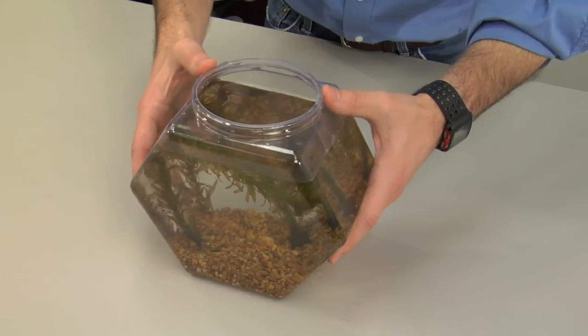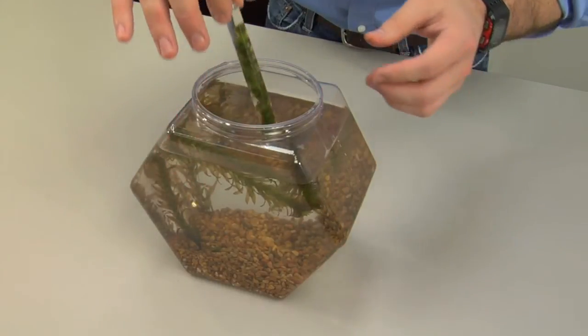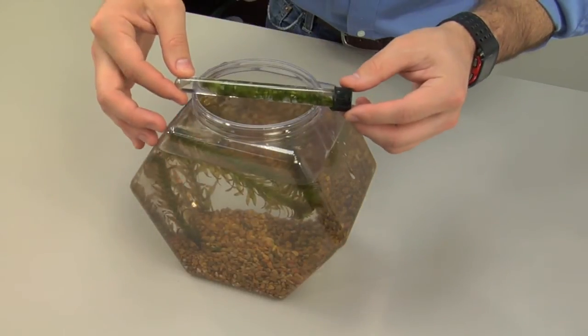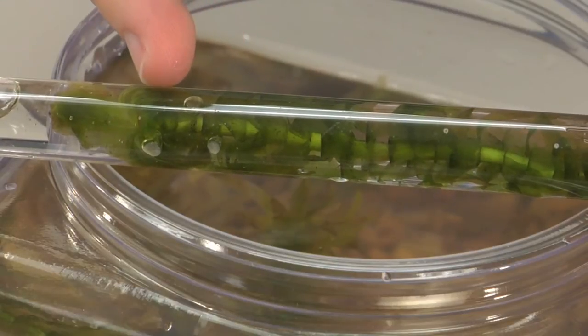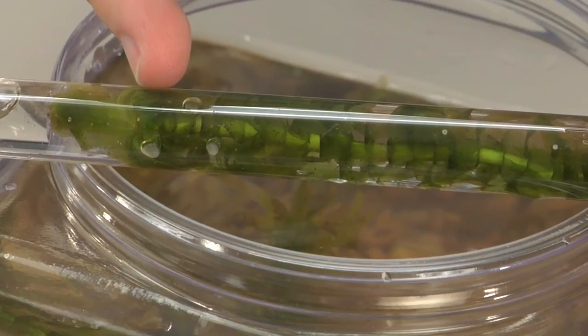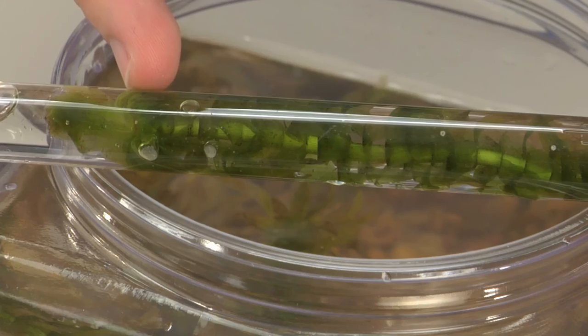Finally, revisit the plants in the window. Carefully remove the test tube from the water. Count the small oxygen bubbles produced by the Elodea plants and record observations in the student journal.